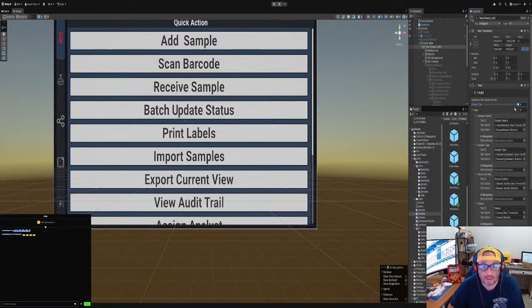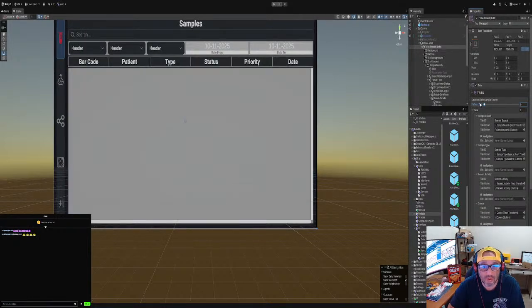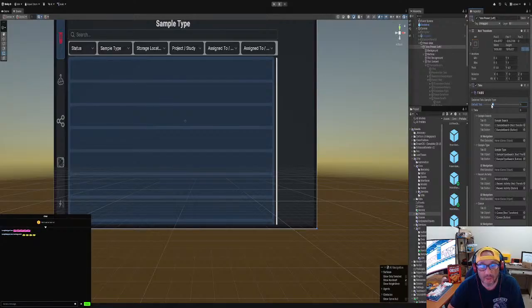So I have a sample search, then I made a sample type because we need to display sample type for the sample search. And then we have recent activities. It just lists the history. We'll fix these later. It lists a list of histories for samples. We have a table for history and it's for everything, but we need to filter out just for the sample.